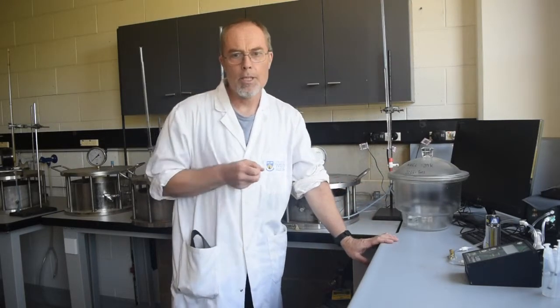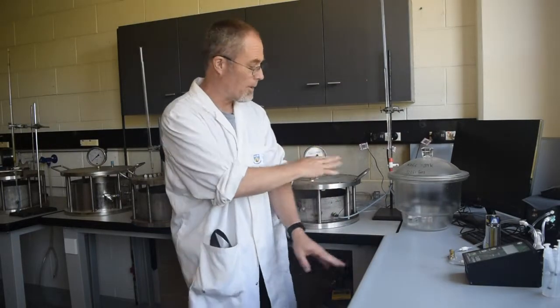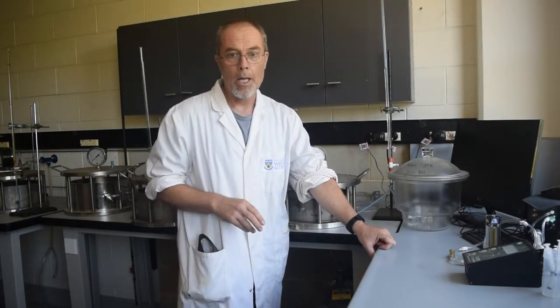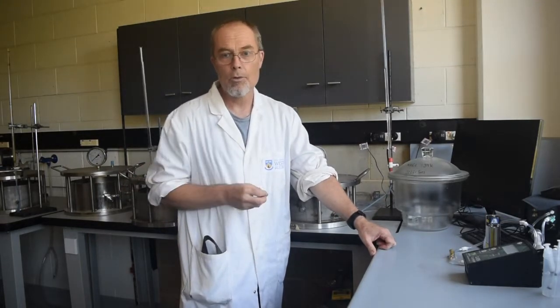With this lab you'll need to spend some time next week to measure the water content of the soil samples after they reach equilibrium at the various range of pressures that we use. And of course, if you're putting wet samples in the oven you need to come back at least a day later to measure the dry weight as well.